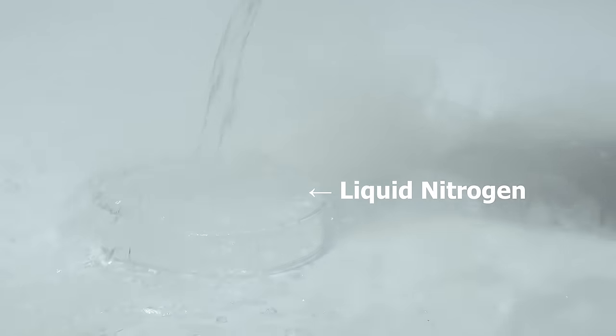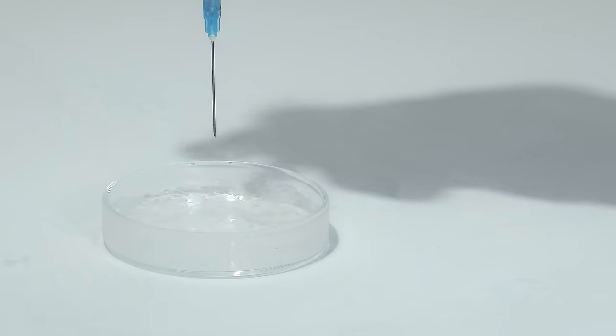To solidify this alloy, I decided to pour it into liquid nitrogen. It solidified quickly in liquid nitrogen, but upon removal, it quickly reverted to a liquid state.